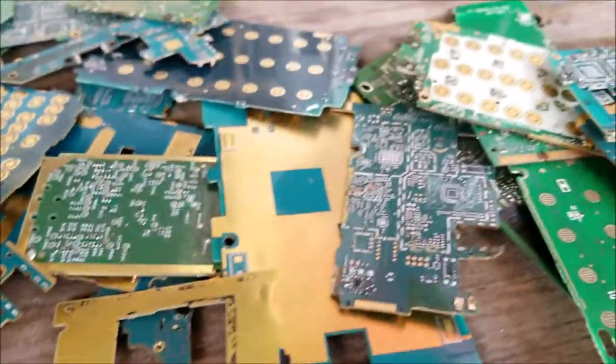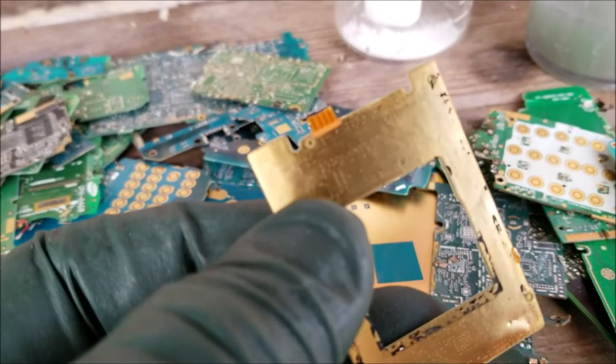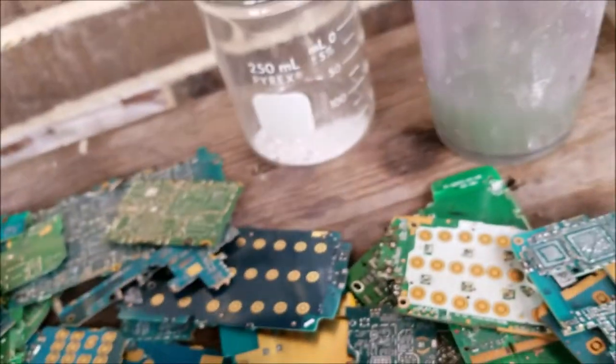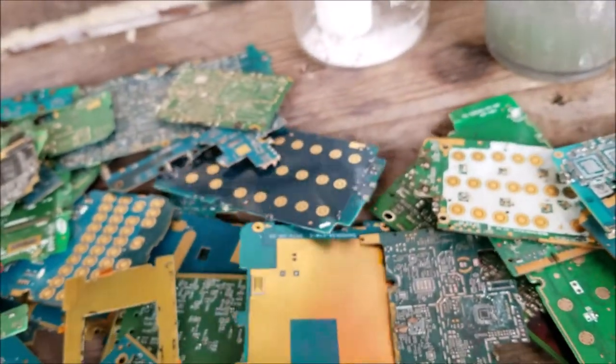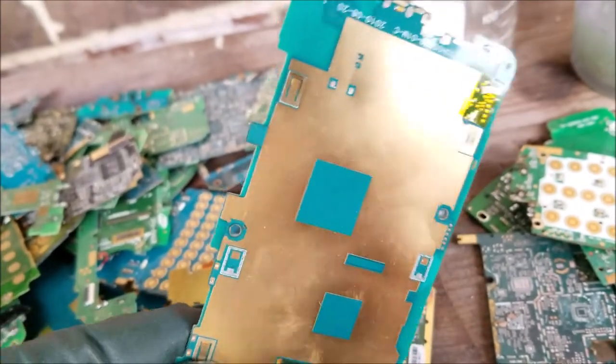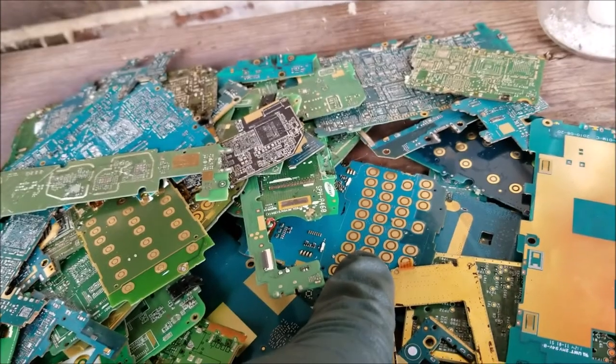As I said, we're going to stick it in nitric acid and distilled water — about 75 to 80 percent water, the rest is 70 percent nitric acid — and it will strip all the gold, leaving it at the bottom along with some other small pieces. Then we'll filter that out and refine it in aqua regia.